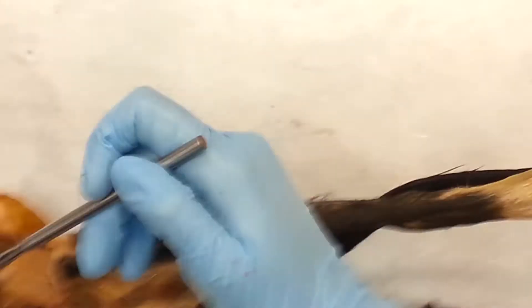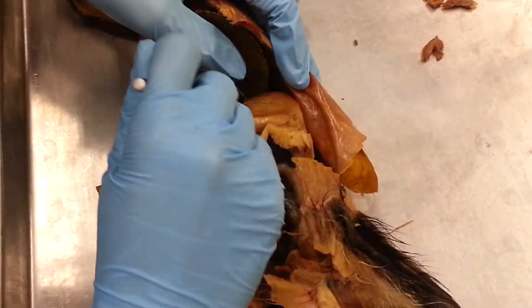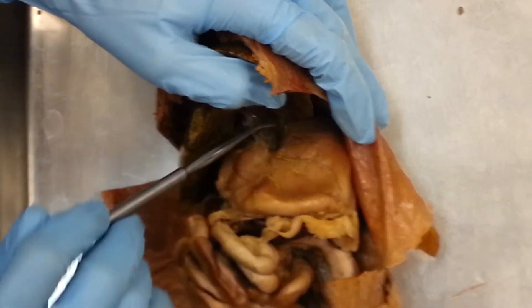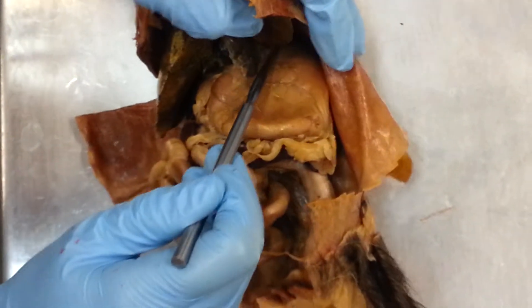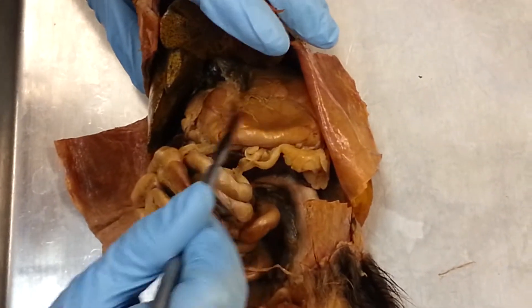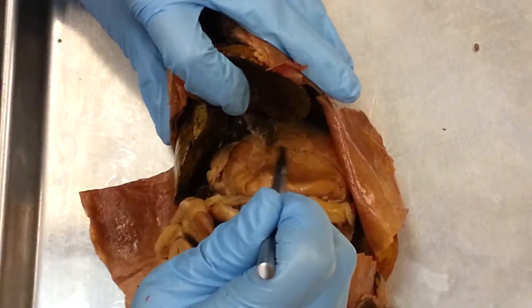This is the stomach. The fundus is the most cranial curve of the stomach, right up here. The greater curvature is along here, and the lesser curvature is in here. The cardiac end of the stomach is just this end close to the heart. The body of the stomach is here. The pyloric region is the very last end of the stomach before the small intestine. The gastric rugae are inside the stomach and they're like wrinkles in the stomach.